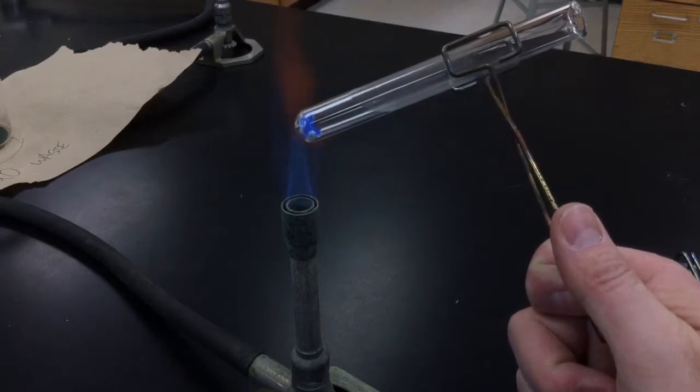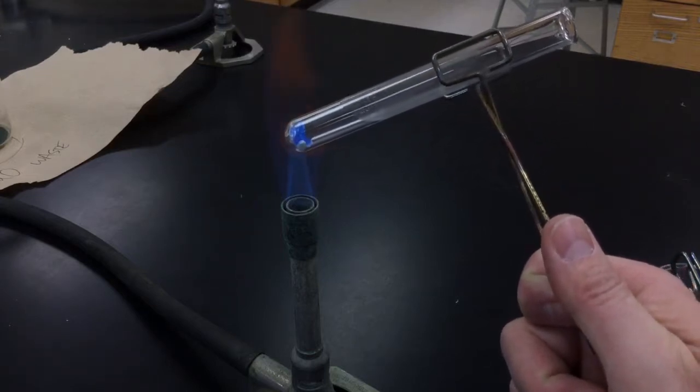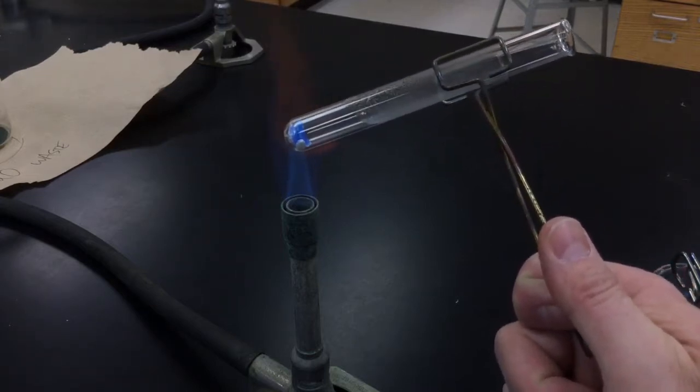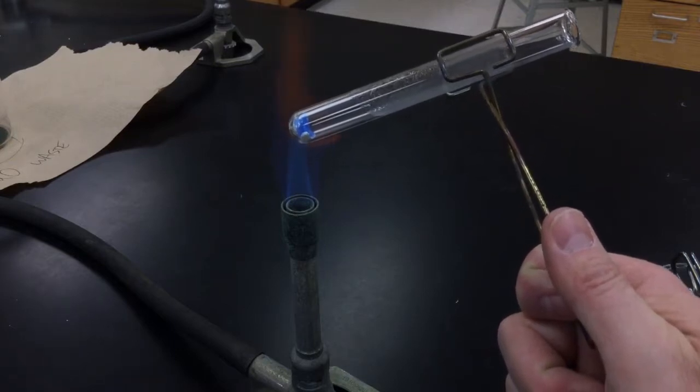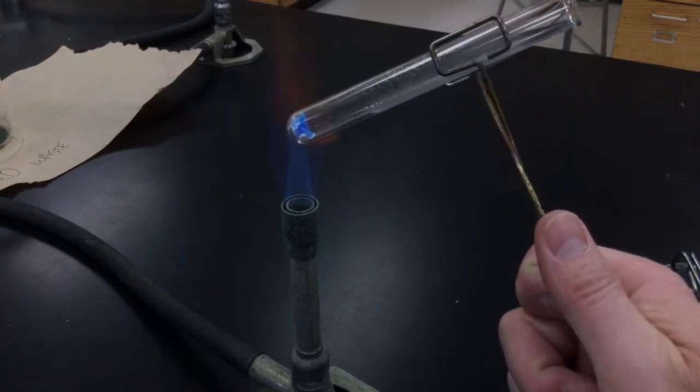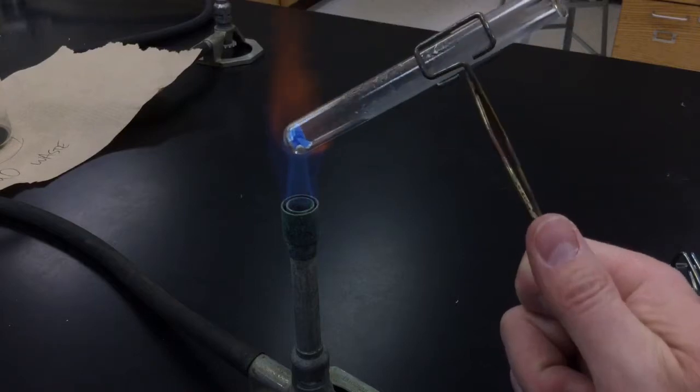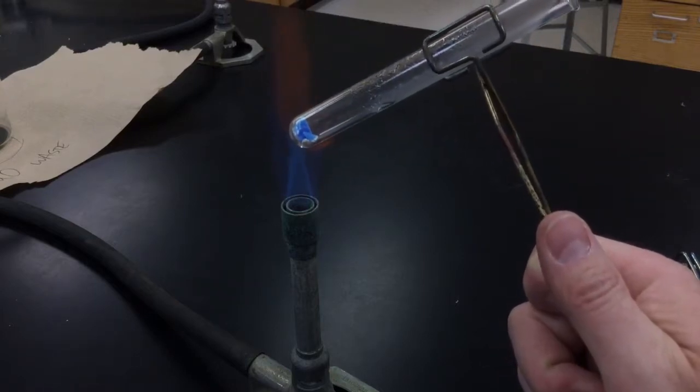Things we notice right now, we're hearing kind of a sound and you'll notice in the test tube that we have some steam that's condensing onto the cold glass there. And of course we see the color change of the solid as well.